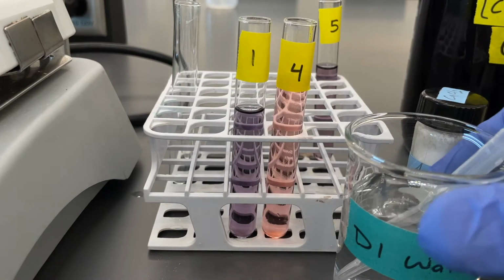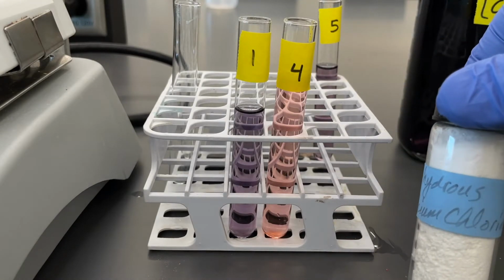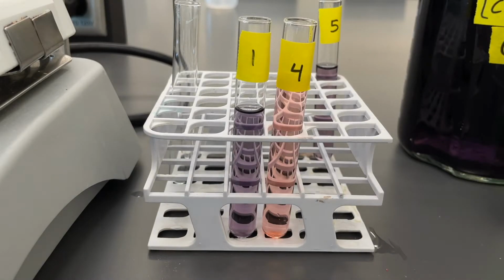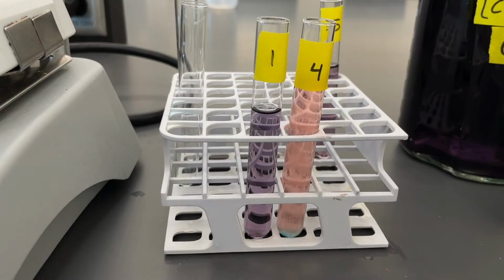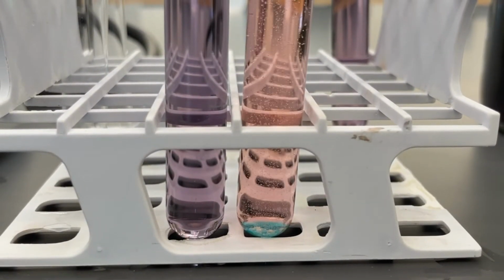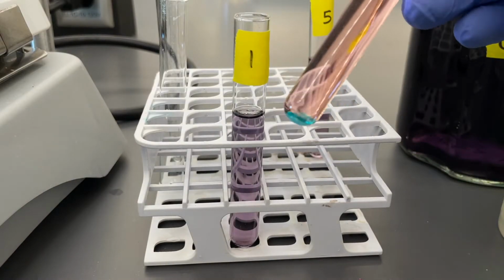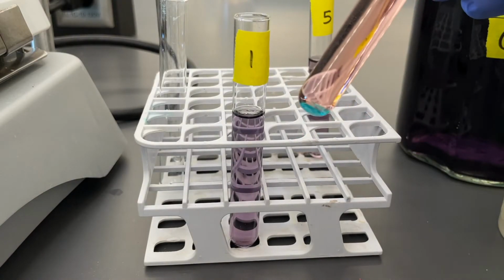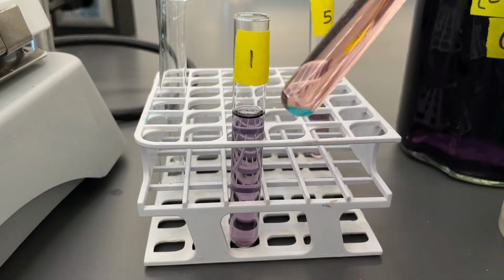And just like test tube 3, we see the expected reaction change. But this time we'll add some calcium chloride. We'll add a small scoopful of it, and we can see what happens right at the bottom of the test tube. So you can see here at the bottom of the test tube, the calcium chloride has turned blue while the rest of the solution remained pink in comparison.